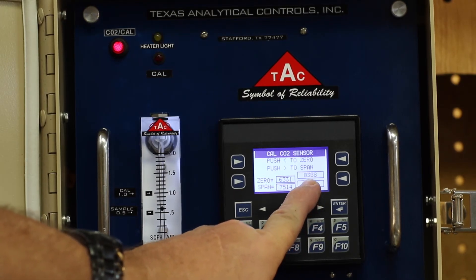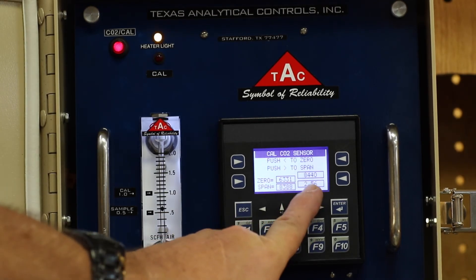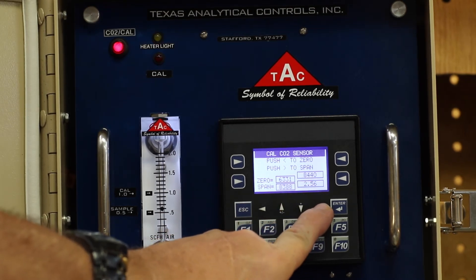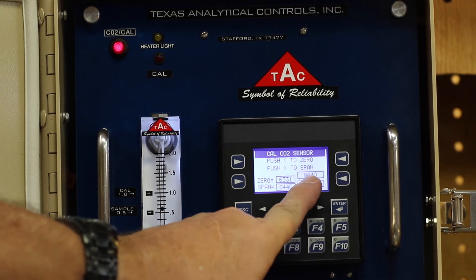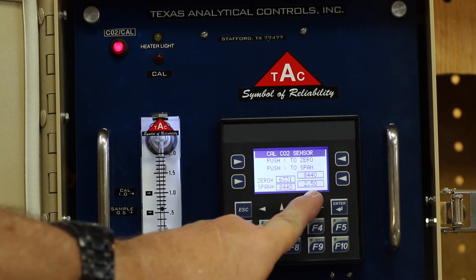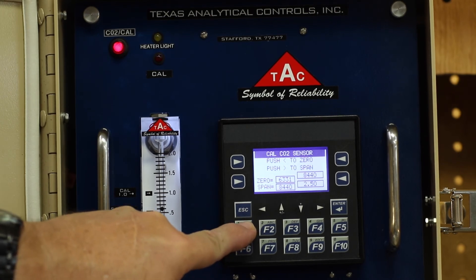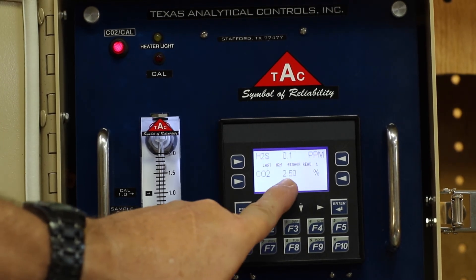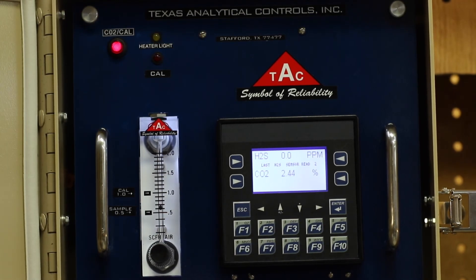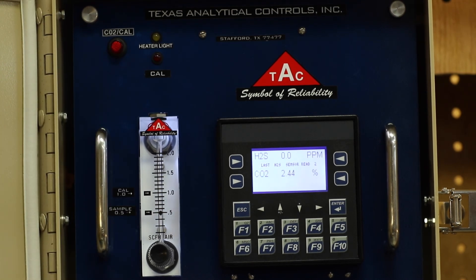Note the counts rising in the current count box. Once the counts have stabilized, press the right arrow button. That will move the counts into your span box and you will note that the reading on the CO2 is now 2.5%. Verify that by pressing F1, going to the main menu, and confirming 2.5%. Now you can turn off your CO2 bottle and turn off the red button. That's how easy it is to calibrate one of our CO2 analyzers.